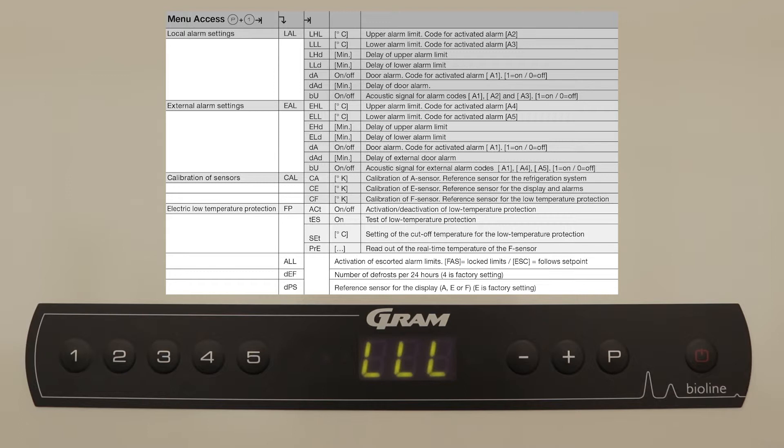Navigate to delay of upper alarm limit. This is set in increments of 5 minutes. Here we will set it to 5 minutes.